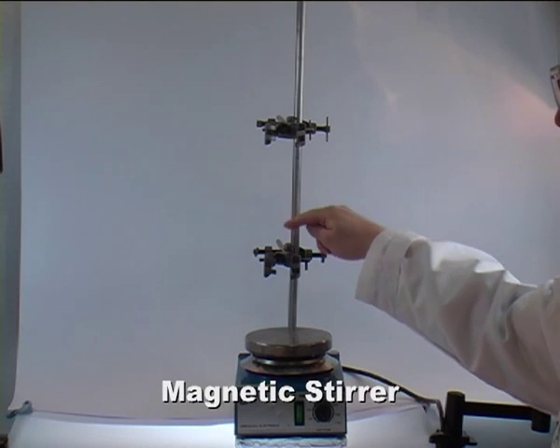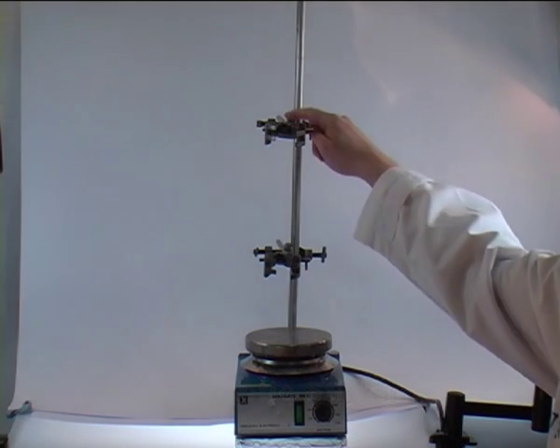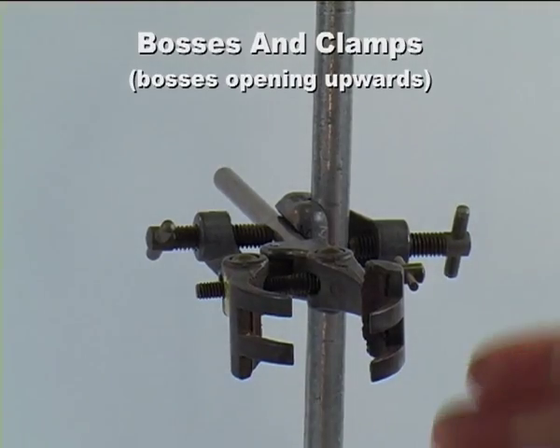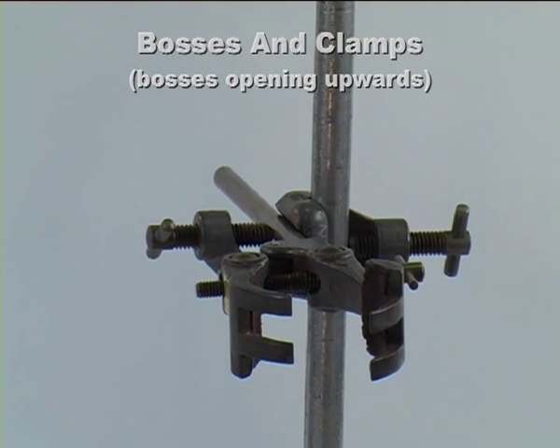And here it is with the bosses, clamped securely and clamped such that the bosses face upwards. Here we have a detailed view of the boss facing upwards.